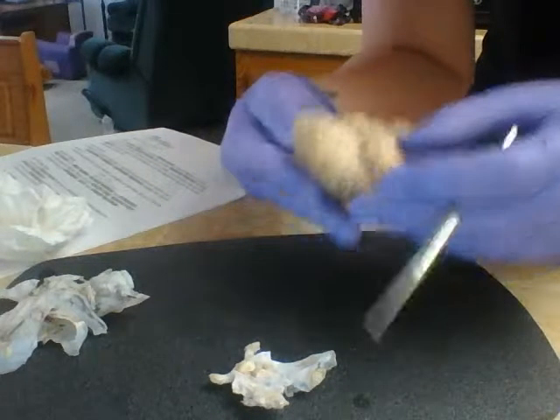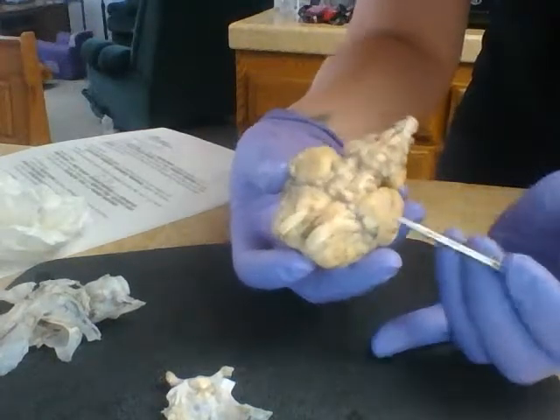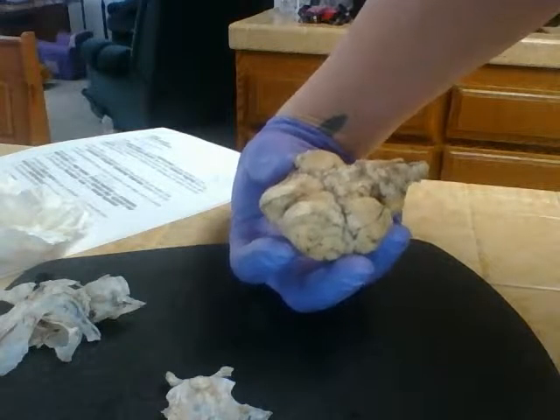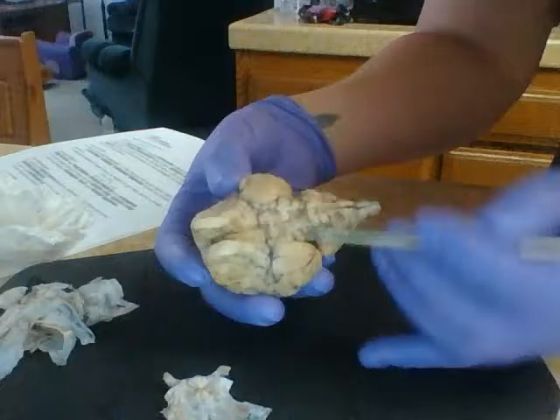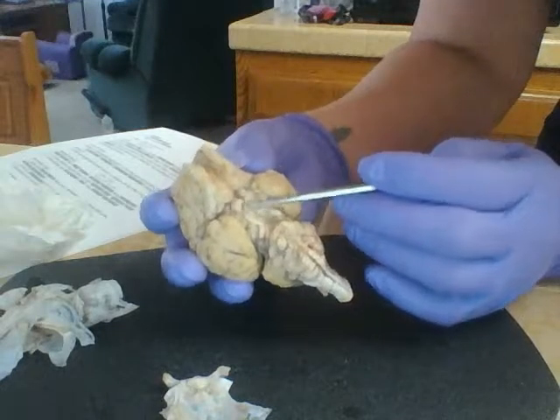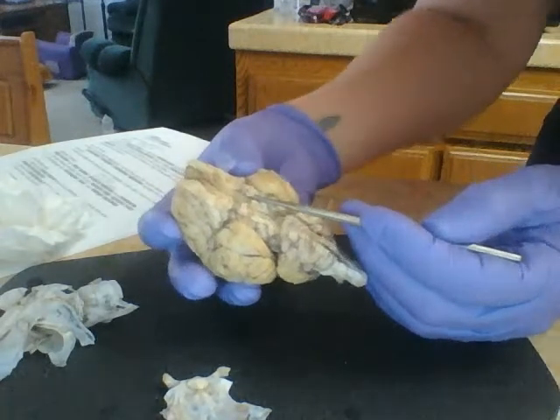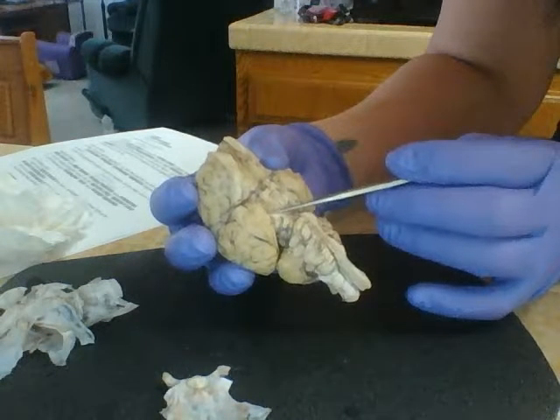And now we're going to try to find some of the cranial nerves. I located most of these guys earlier, but they can be a little tricky in relocating. So first, we've got the oculomotor. So the oculomotor sits right about up here. So we can see they're a little bit bigger, some of the bigger guys, and they're on both sides. We've got the trochlear nerve, which are smaller, and they come down right about here.